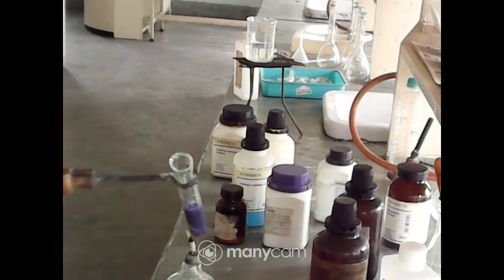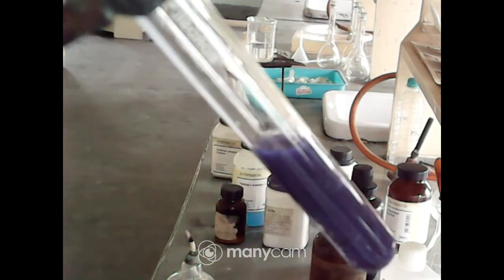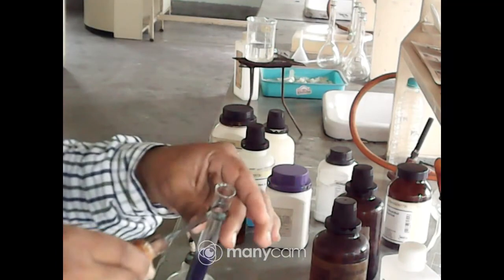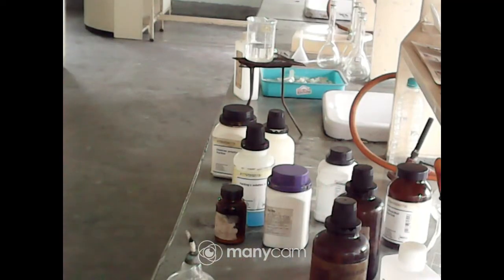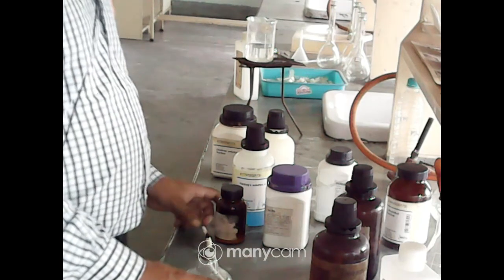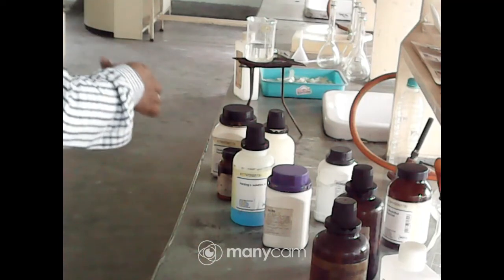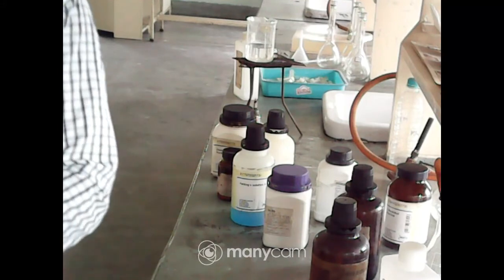Okay, now we got our result. This is the blue coloration after adding ninhydrin solution. So this is also the confirmative test for protein. Now the test of fat, I have written, but as I told you that it will not be included, so just write this experiment as it is included in your syllabus.